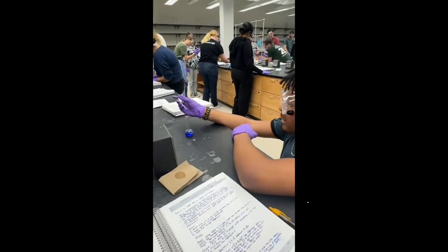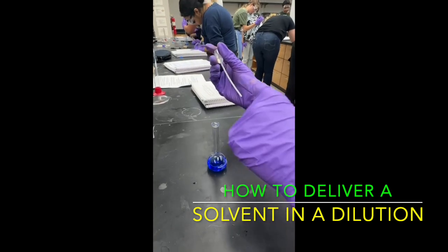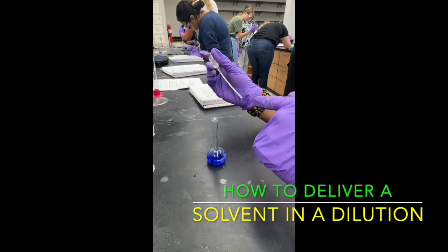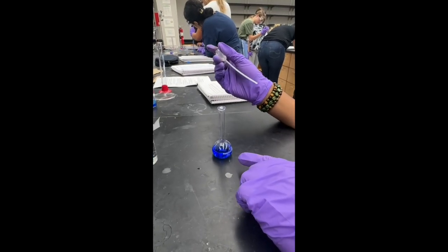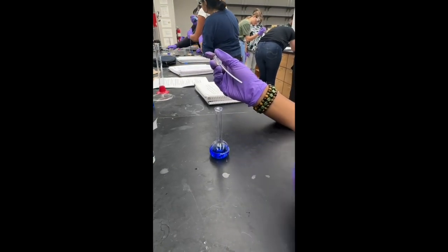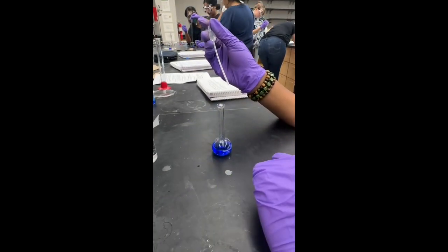So the main point of a dilution is adding a solvent, such as water, in this case water, to your solute, which is our copper amine. So we're going to add our water to our copper amine to reduce the concentration.